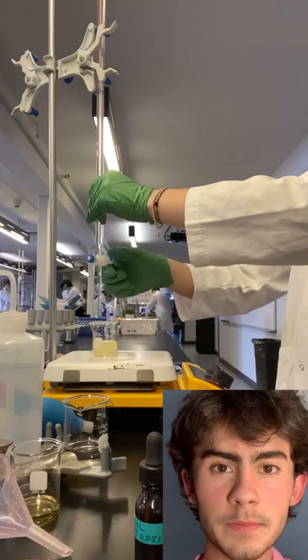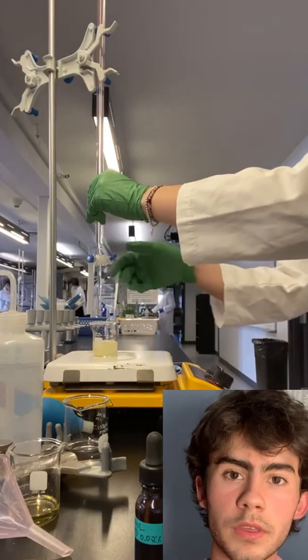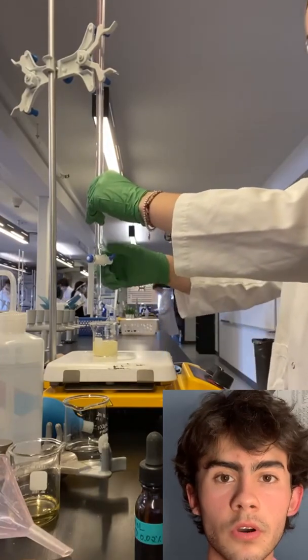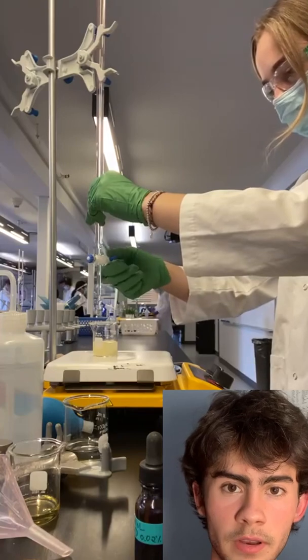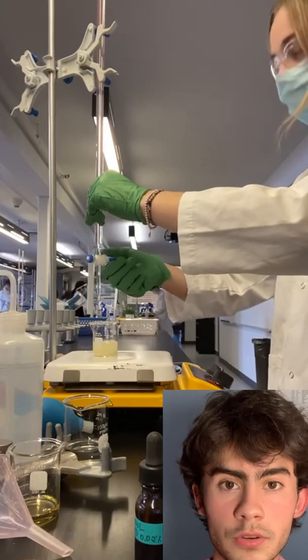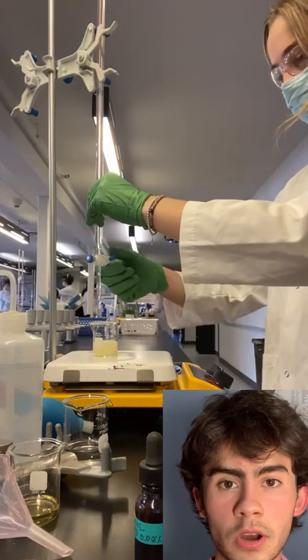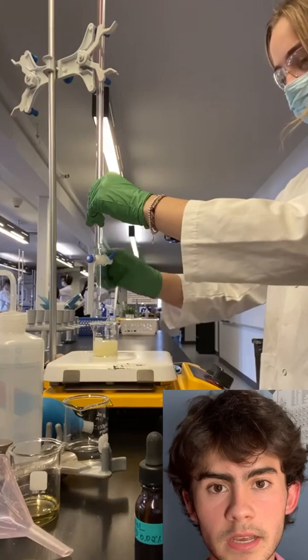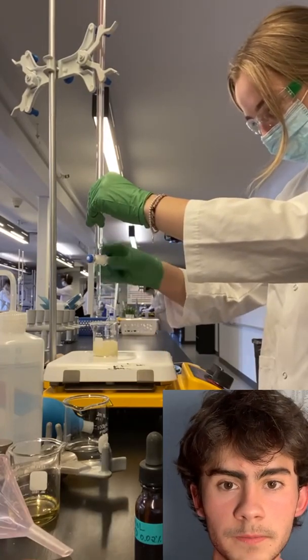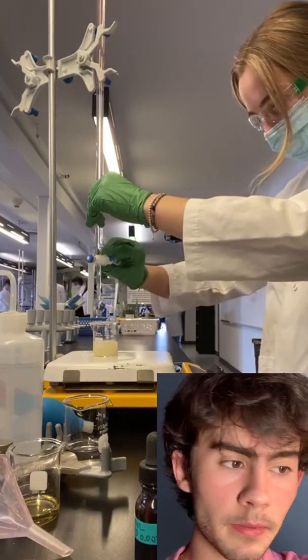This is because when making the catalyst, so by mixing the methanol with the potassium hydroxide together, there is a possibility for the OH and the K ions to separate from the potassium hydroxide, and then the OH ions would form water, H2O. During the transesterification, if the H2O comes in contact with the free fatty acids, this would create the soap. This is why there could be a saponification. Now let's talk about the procedures and the different materials used during the lab.